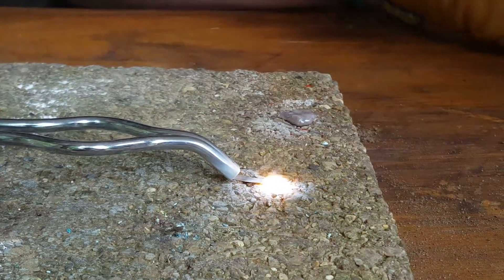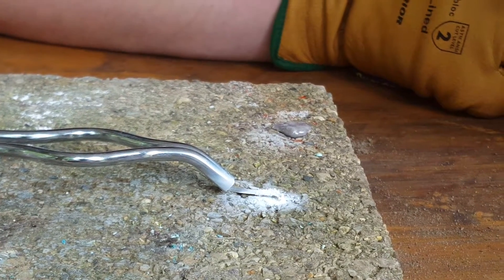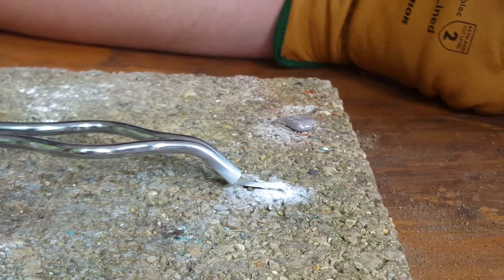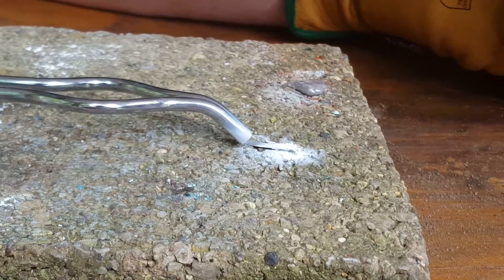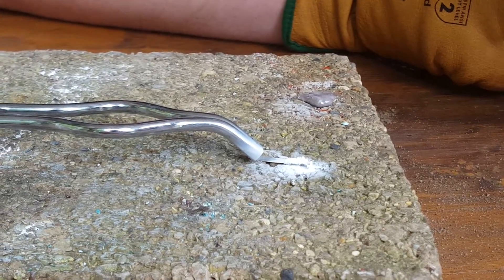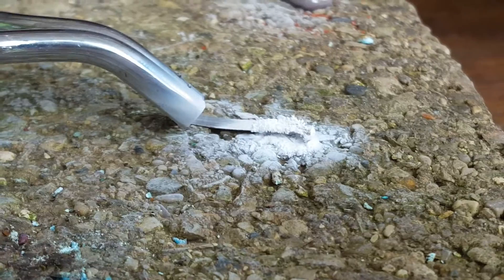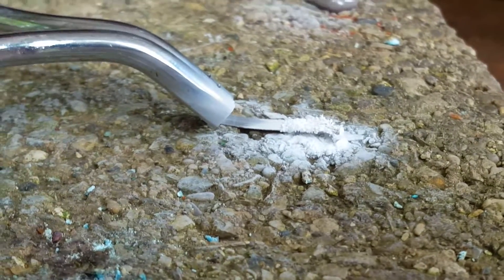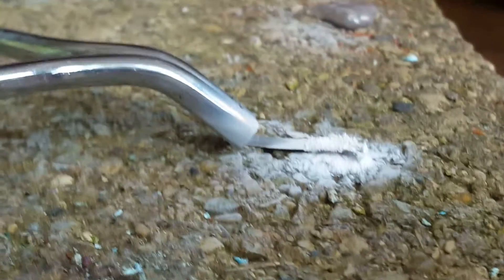It also cannot be put out with water, so we're just going to let that burn out on its own. And as you can see, it leaves behind a white salt of magnesium oxide.